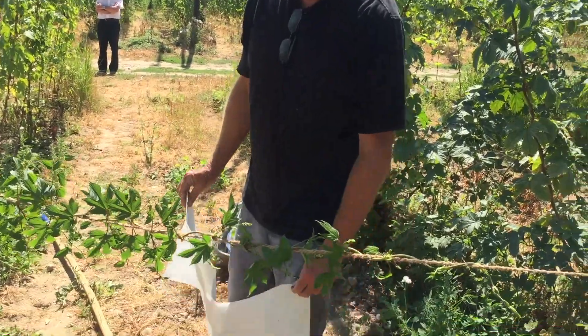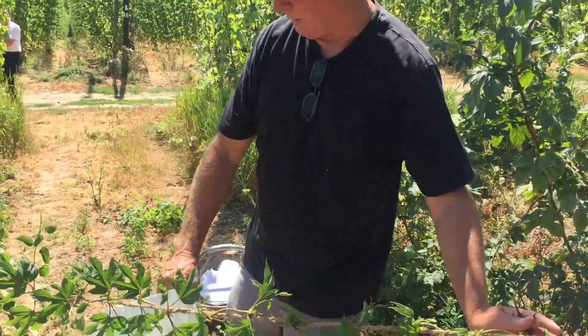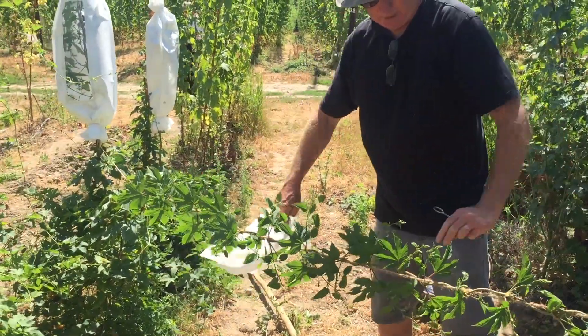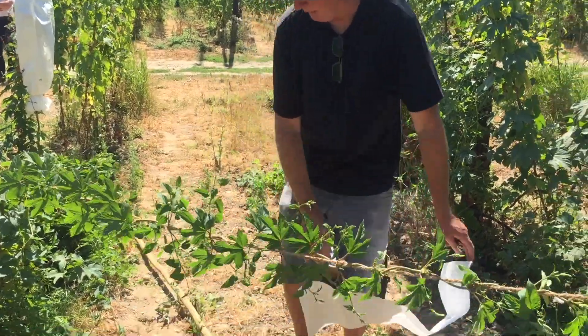Where on the plant is the best place to have a sleeve? Every plant will flower differently — some will tend to flower more at the top, some will flower more evenly. So we choose the correct place, which looks to be about here.